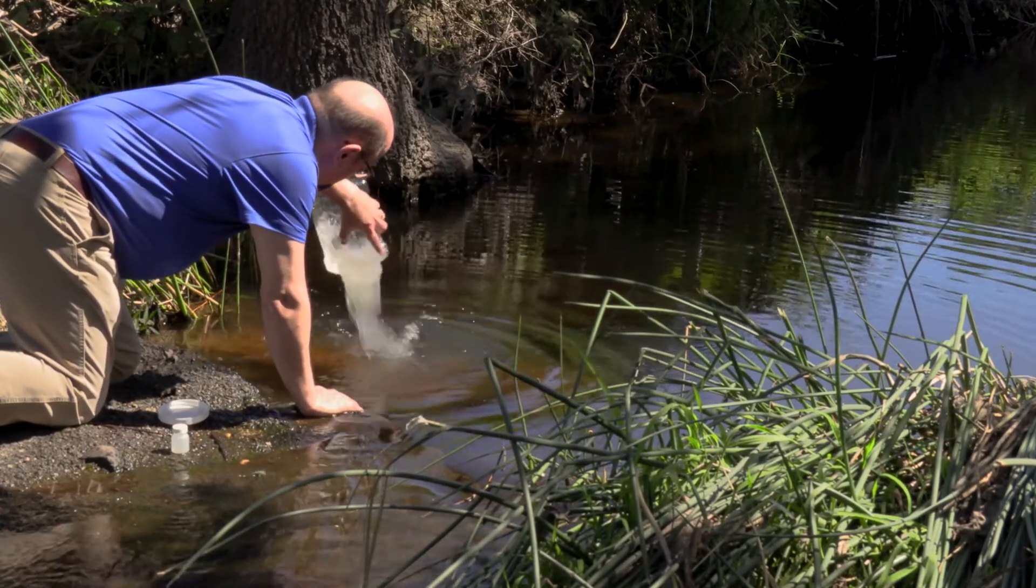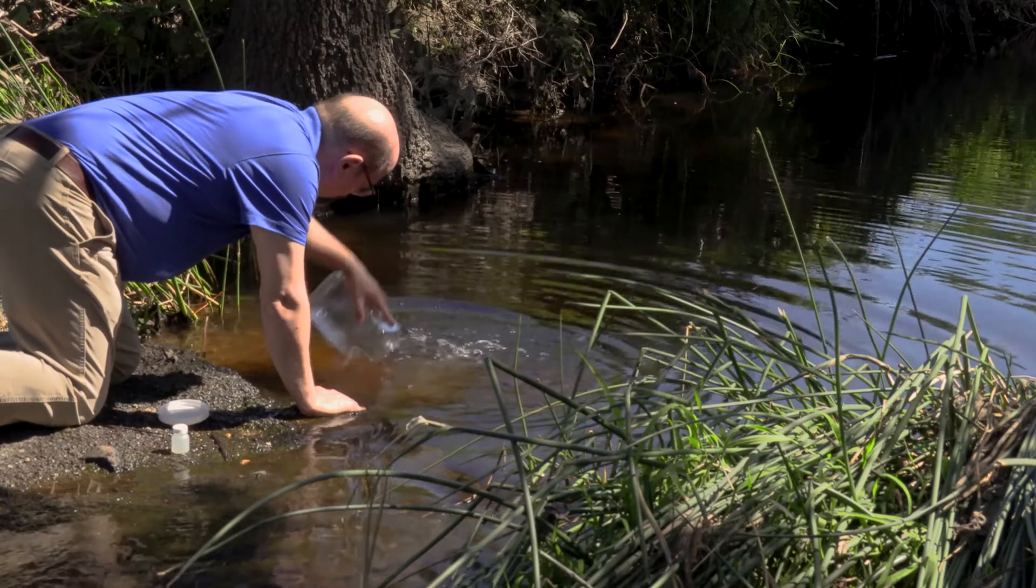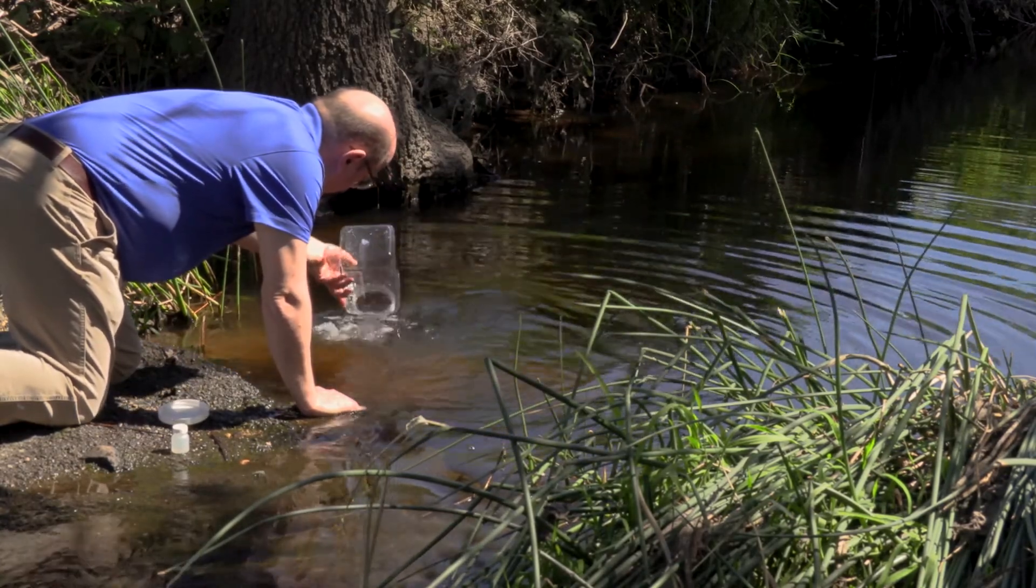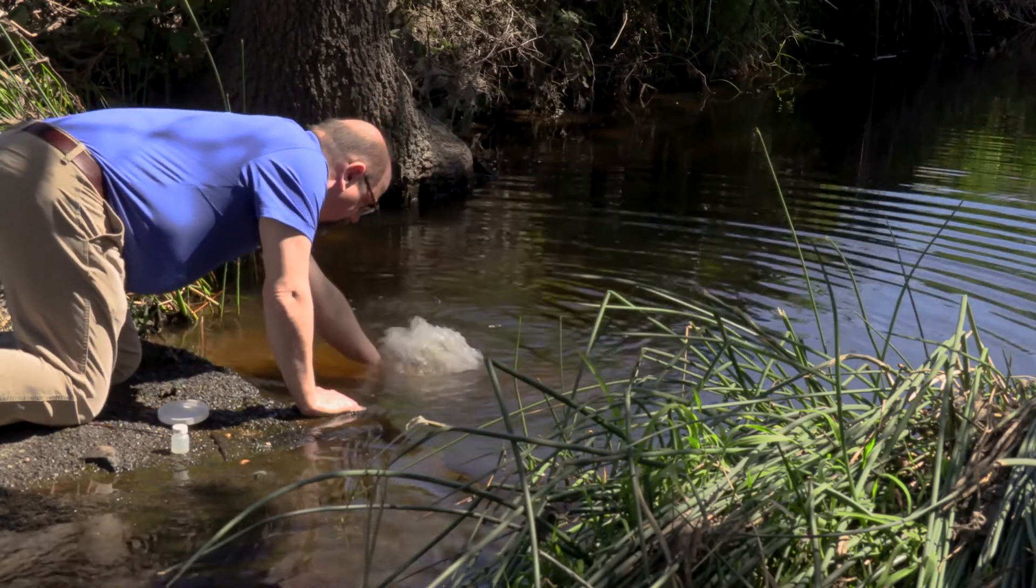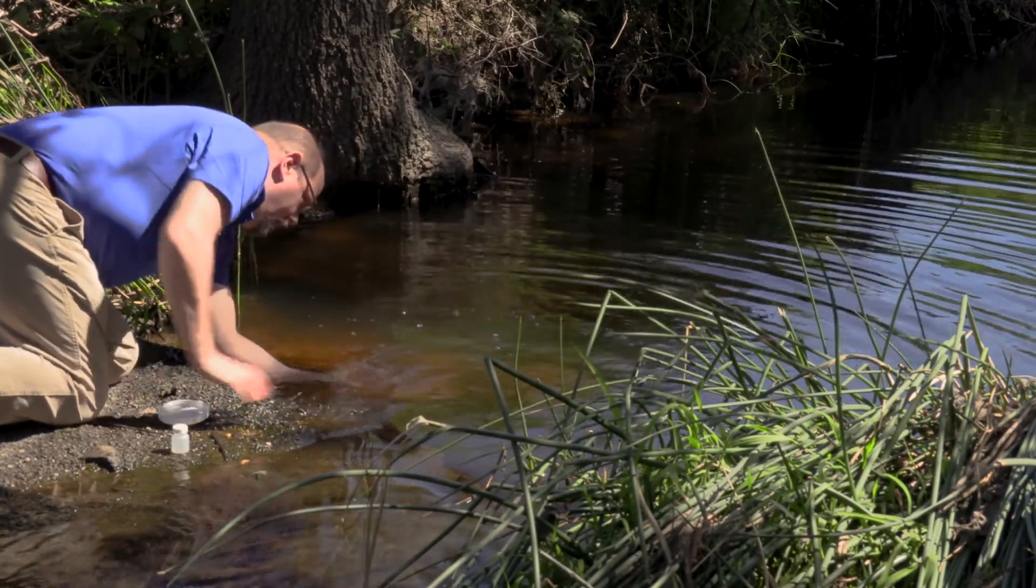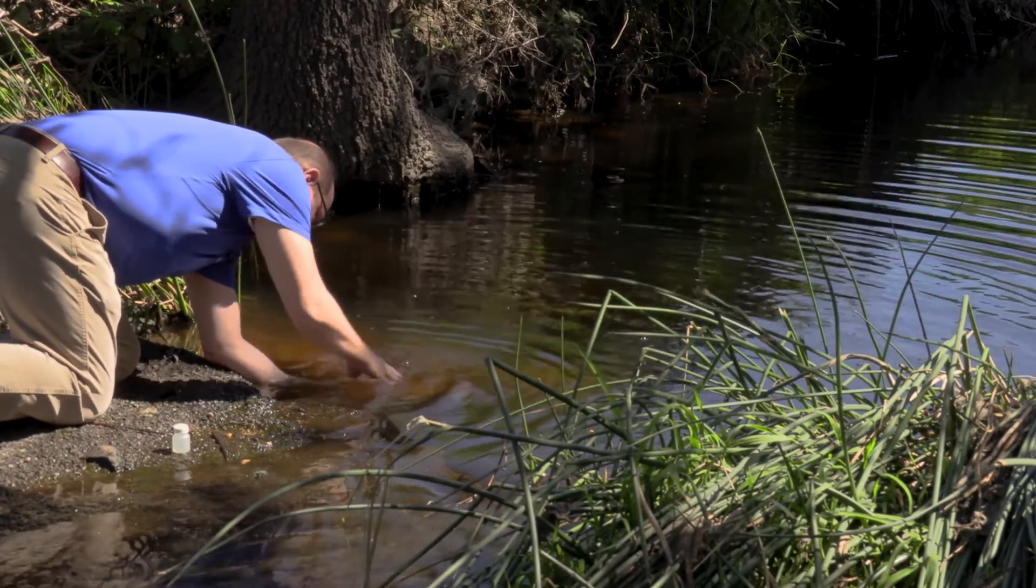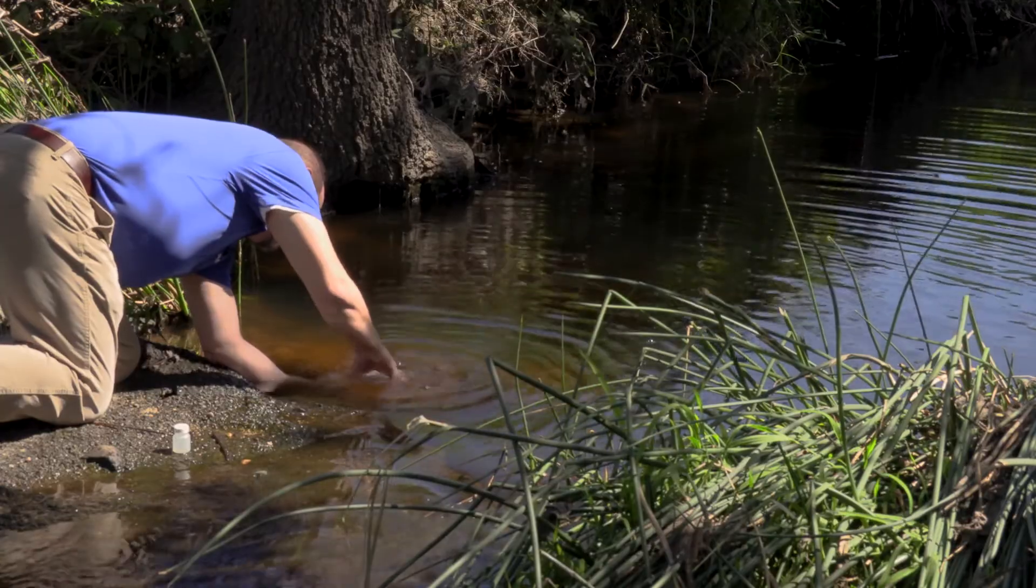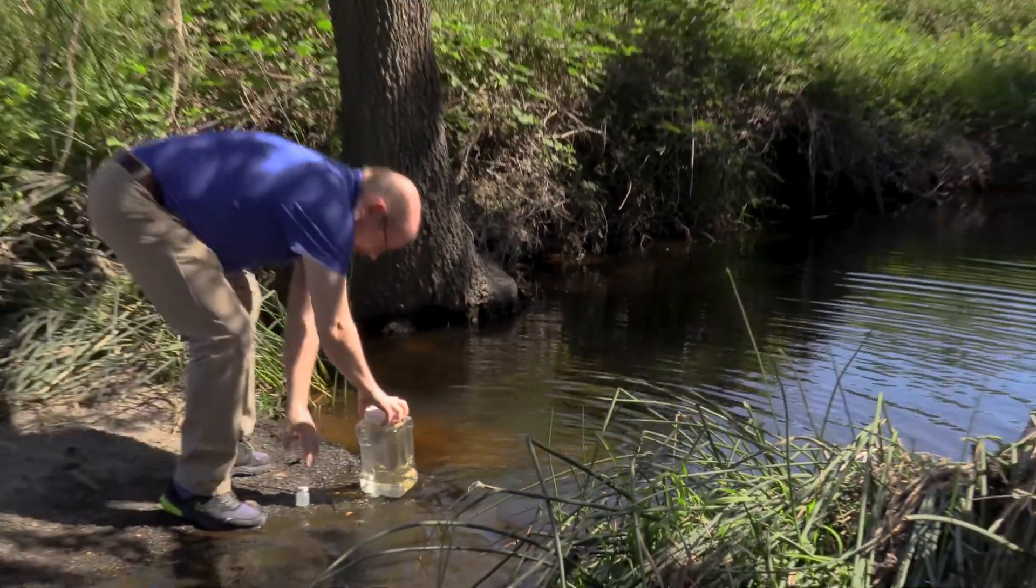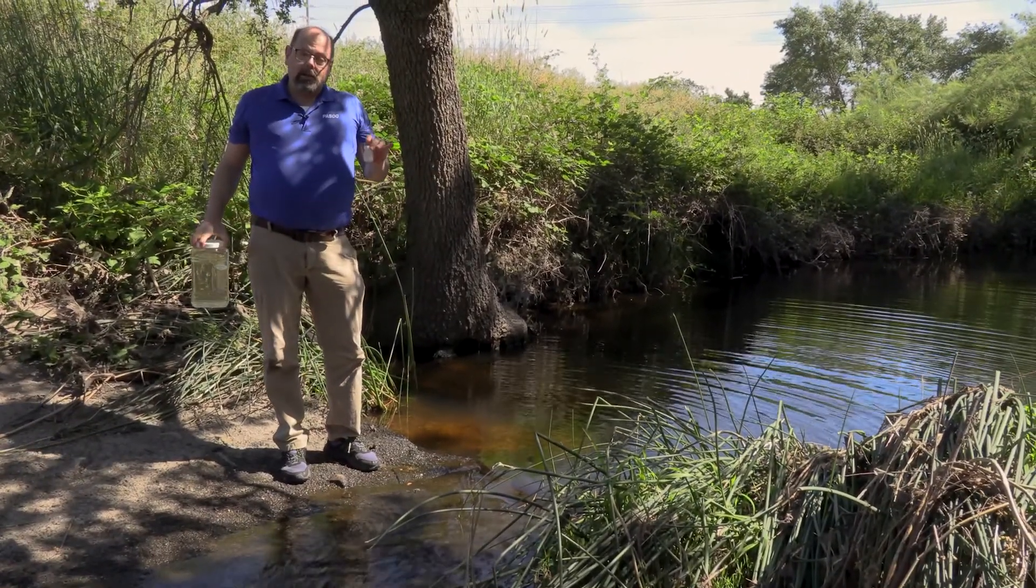Now let's do the large sample. We'll rinse that out a couple times. Then this last time I'm going to put underneath, fill it up to the top, and we'll seal it. Here you see we've gotten our water quality samples. We're going to take it back to take a look at it in the lab.